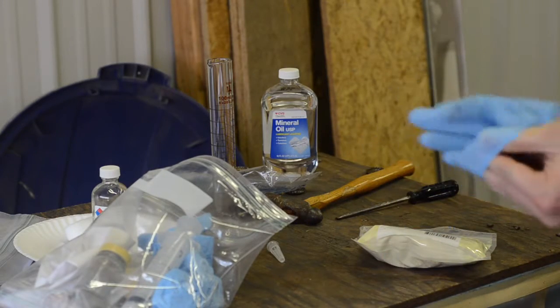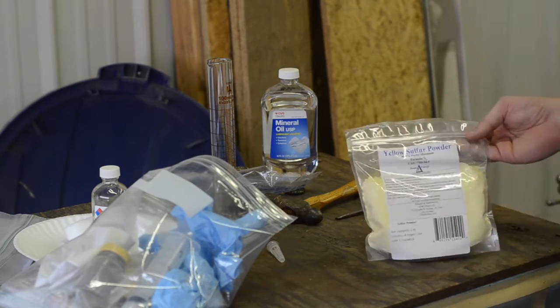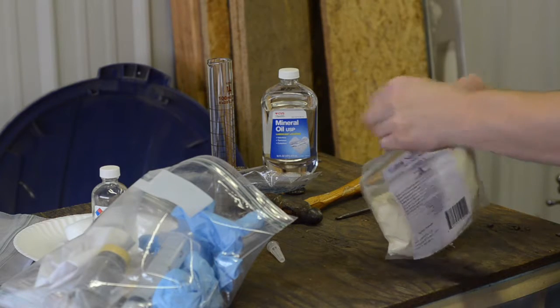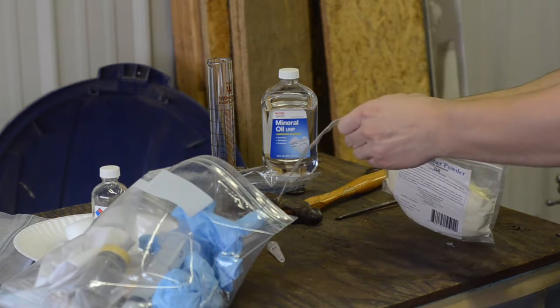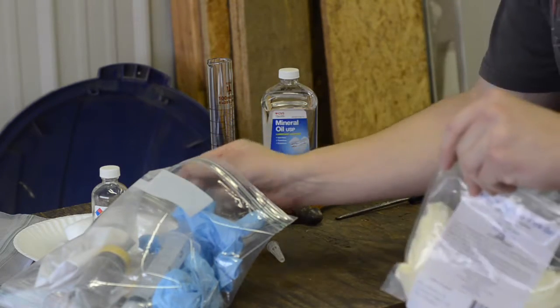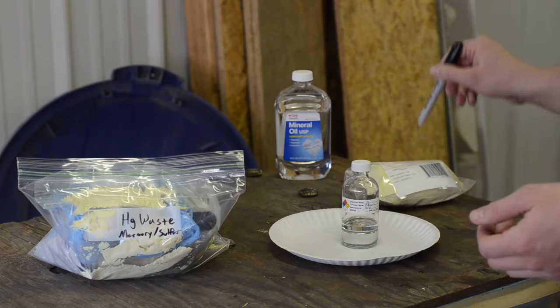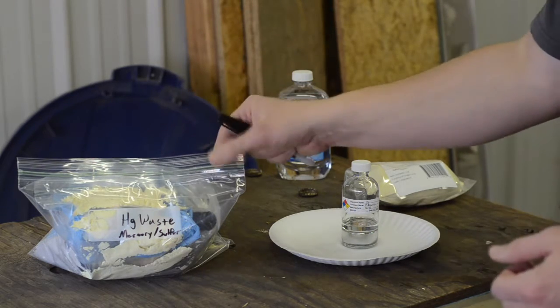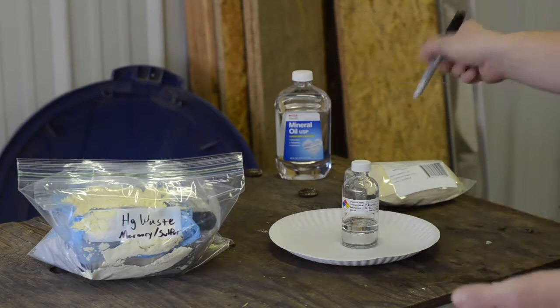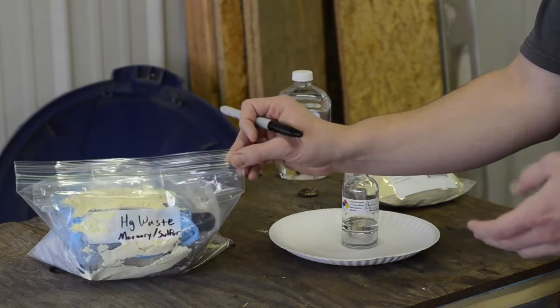All right, in a last step here to try and clean up my graduated cylinder, I've got some sulfur powder. And I don't know how well this is going to work all in all, but the goal here is that the sulfur should stick better to the mercury than anything else I've got access to. Okay, so we've got our mercury now fairly safely stored. And we've got our mercury waste bag here, which has now been double bagged. And I poured sulfur on top of it because I don't know what I'm going to do with even this much sulfur. So now this will go to a chemical storage waste facility.